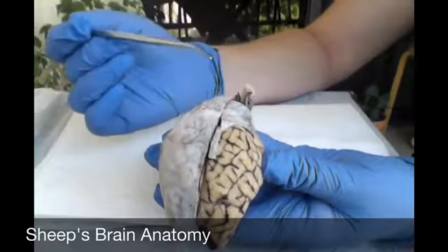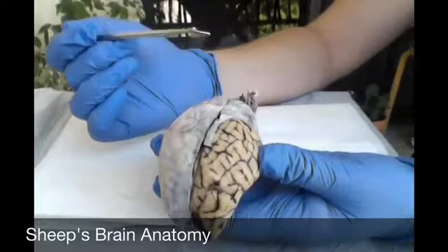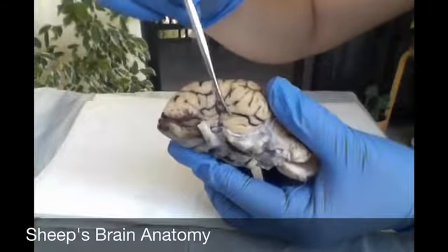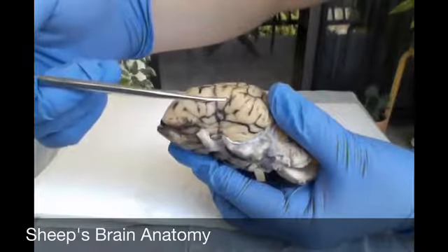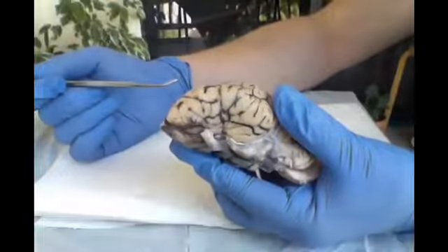And next, we're going to look at the lateral sulcus, which divides the temporal and parietal lobes. And that one is right down here. So you can see the temporal is down here, the parietal is above. And this sulcus is one of the earliest developing sulci of the human brain.